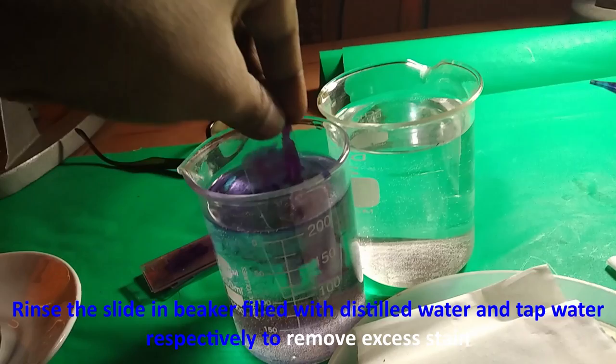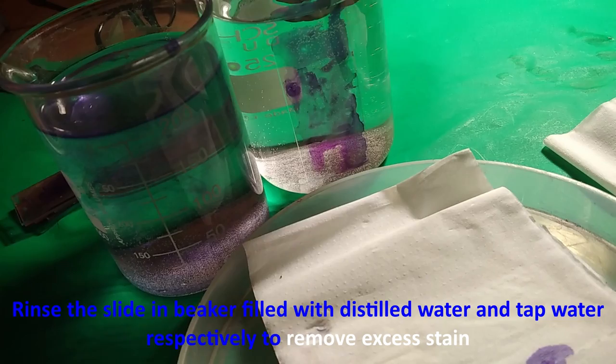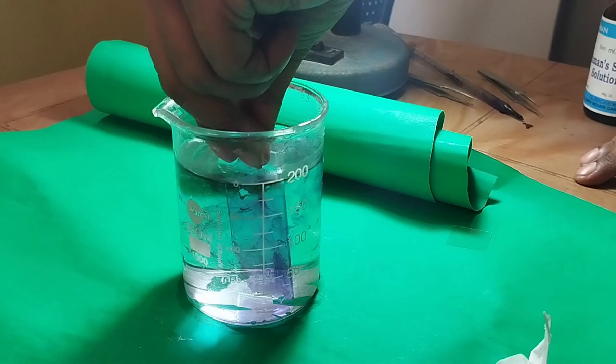The 5 to 10 minutes duration for staining is very much variable. Try out different time intervals — 5, 6, 7, or 10 minutes. We are also doing this with Methylene Blue. During this practical session, we tried all possible kinds of staining.